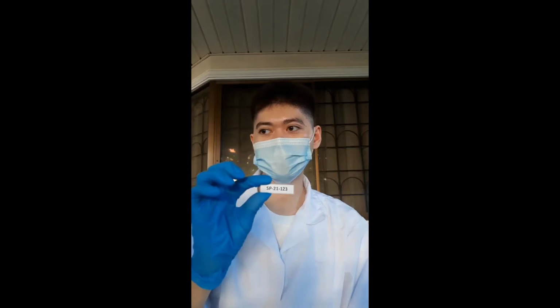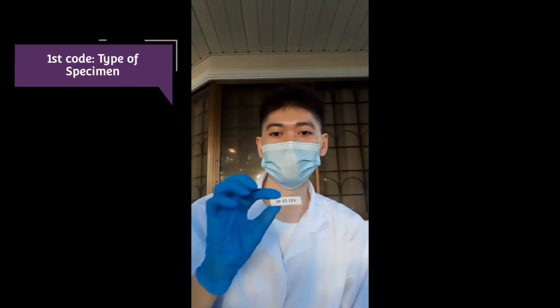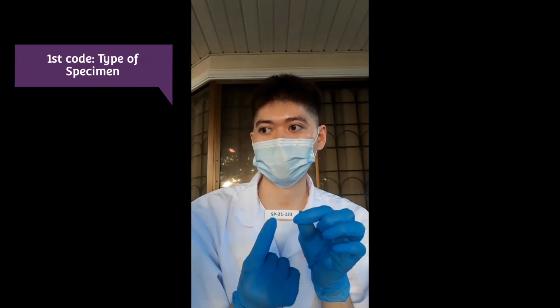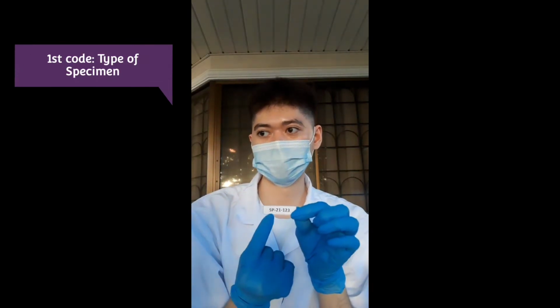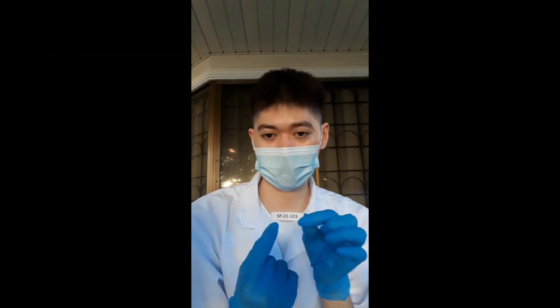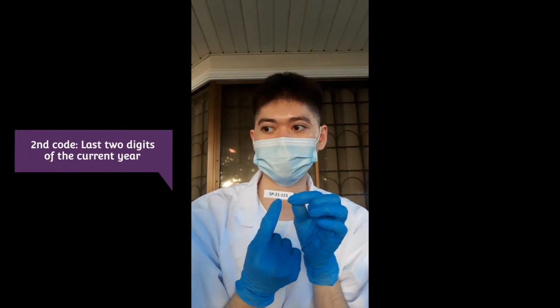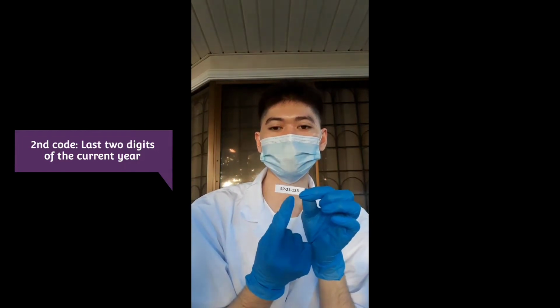So it has 3 codes, and the first code can either be SP or AP. SP means surgical pathology and comes from the specimen of a live person, while AP means autopsy pathology, which comes from the specimen from a cadaver. So moving on to the second code. The second code is the last 2 digits of the current year. So now it's currently 2021. That's why it's indicated there as 21.